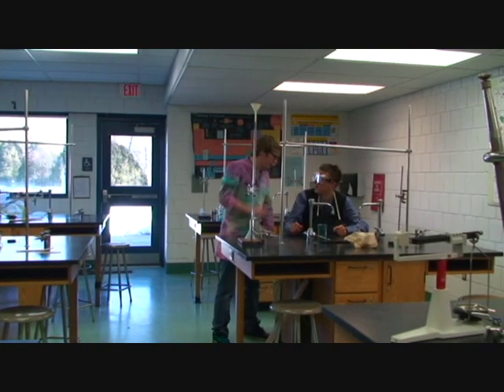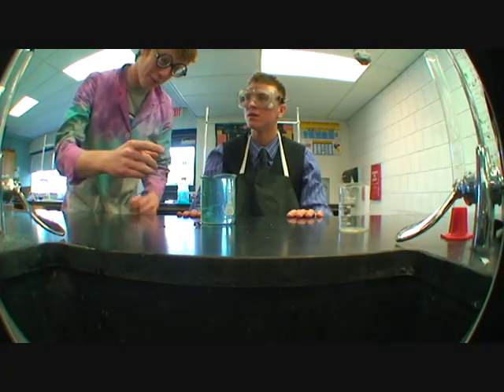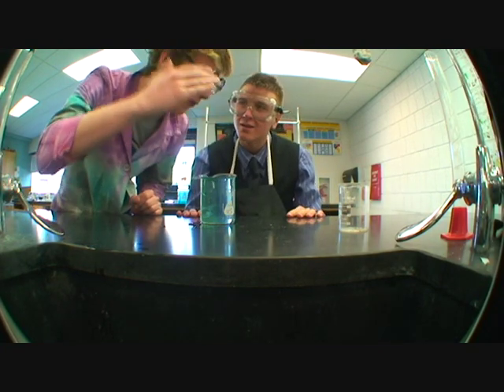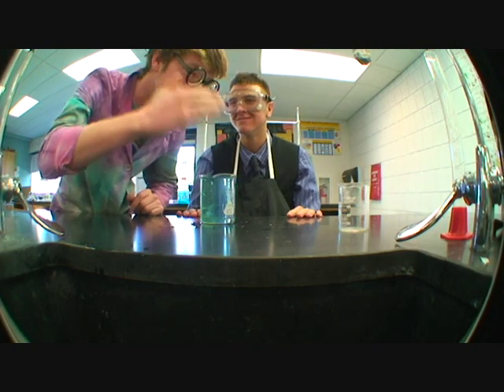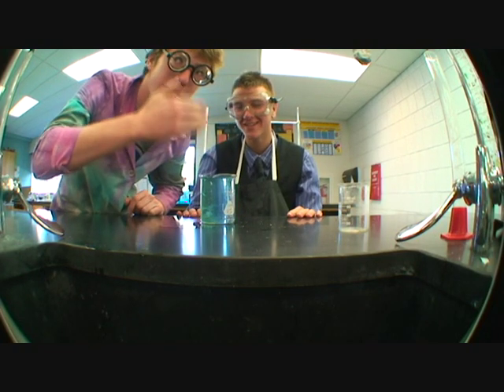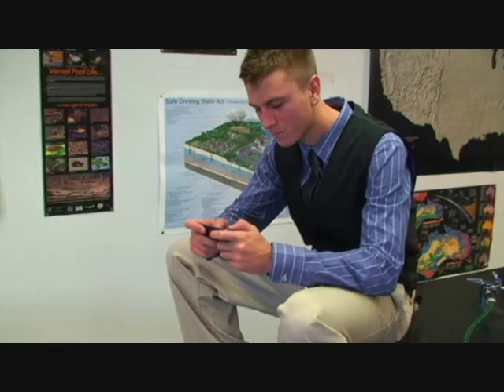Oh, what are you doing in my laboratory? That is not the proper way to smell stuff. The proper way is to put your nose over here and waft the scent into your nose. See the wafting? Notice the wafting? Notice the nose? As you can see, I'm properly wafting. That's a good little girl.